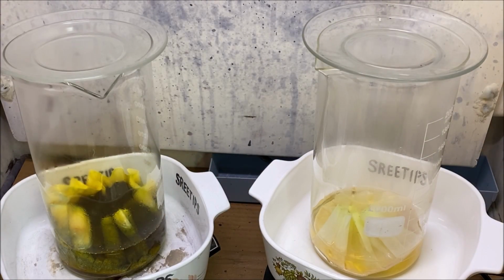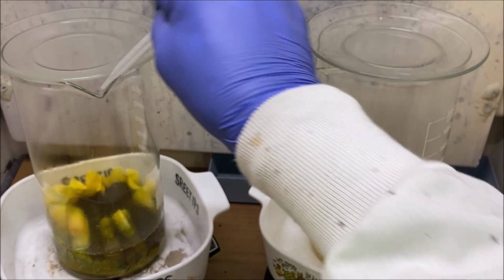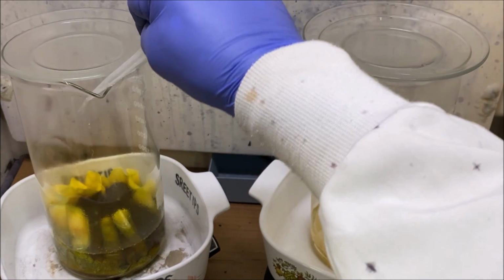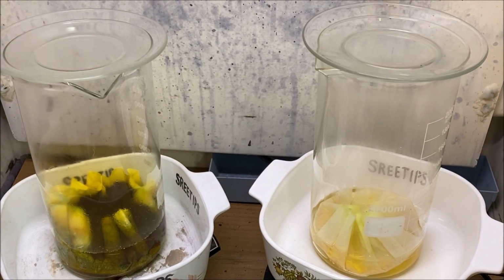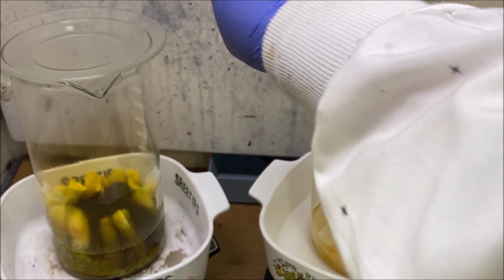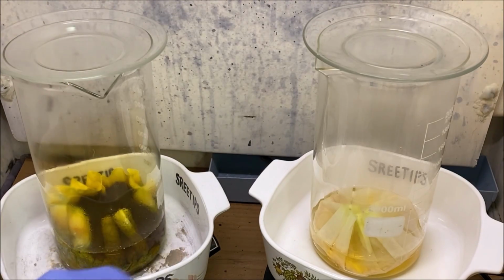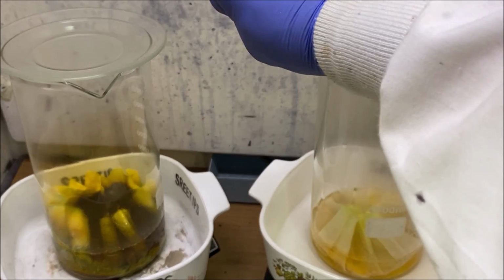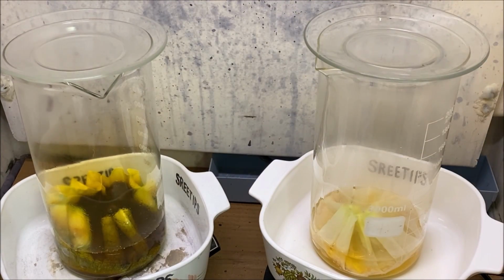Alright, these have been on the heat now for about 5 minutes. They're starting to react. I'm going to put a couple more squirts of nitric in this one. And I'm going to have to keep an eye on this one over here. I've had this precipitate dissolving in aqua regia run away on me, a delayed or runaway reaction when I add nitric acid to it. So we're going to keep a close eye on this one.